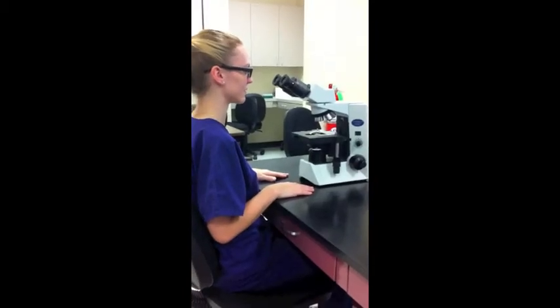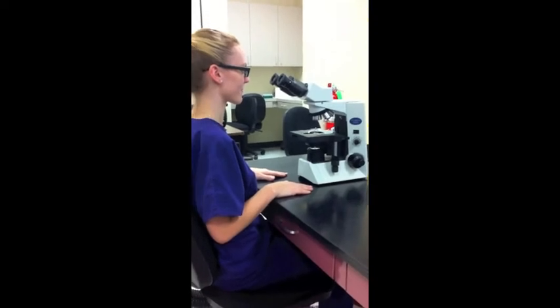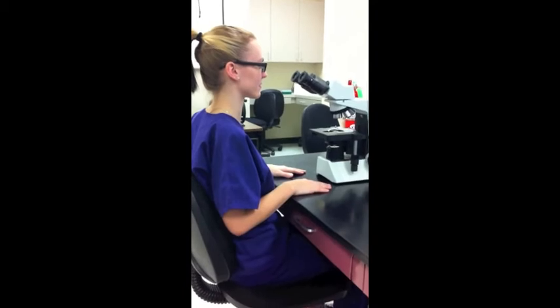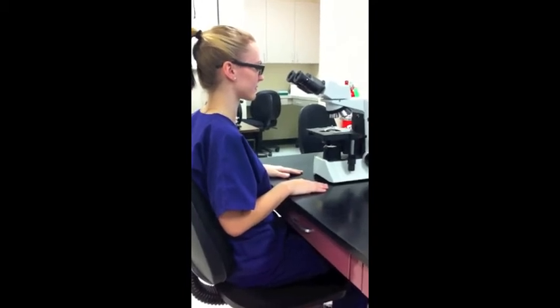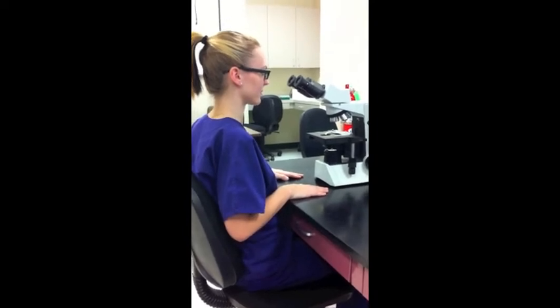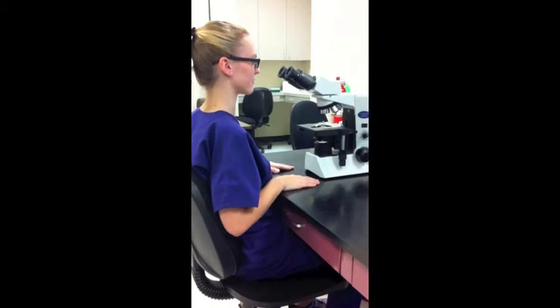At this point, the microscope is now safely on the lab table, plugged in, and ergonomics are taken into consideration. The proper technique would be to have the microscope at a comfortable distance, eyes looking straight ahead, shoulders relaxed, back properly to the back of the chair.